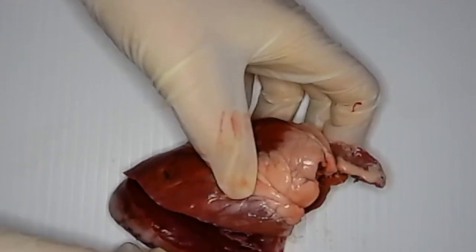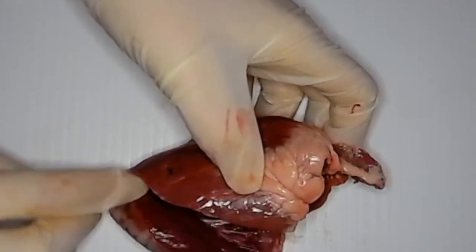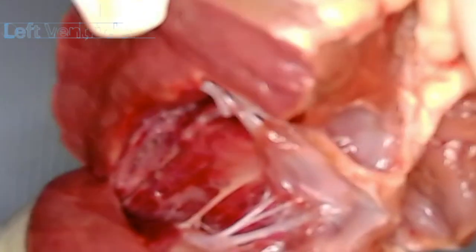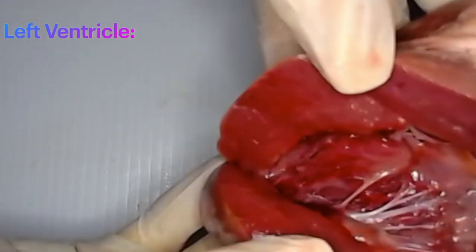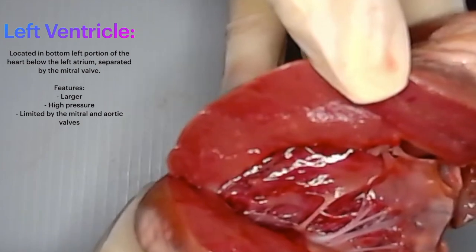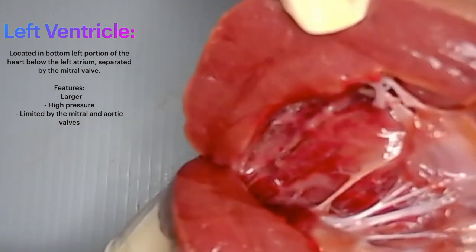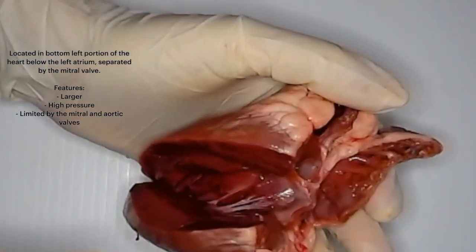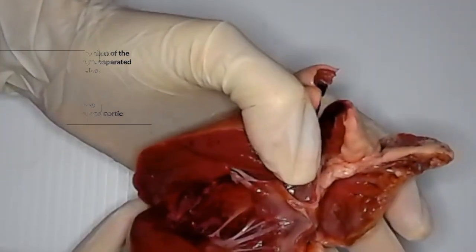What I have done is cut a line down the left ventricle, and I'm just going to open that up and let you have a little look into the heart. All right, so there's lots of interesting things on this side of the heart.